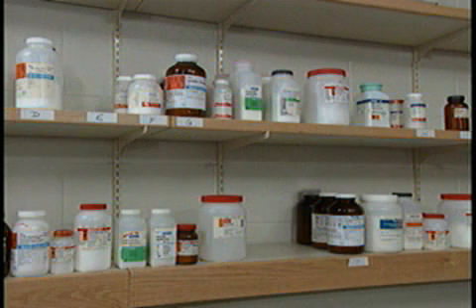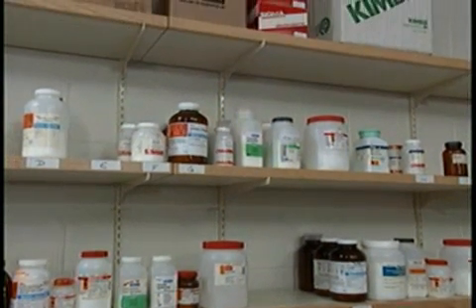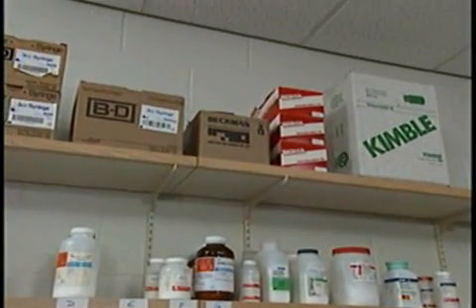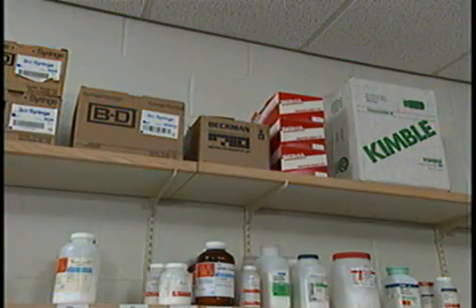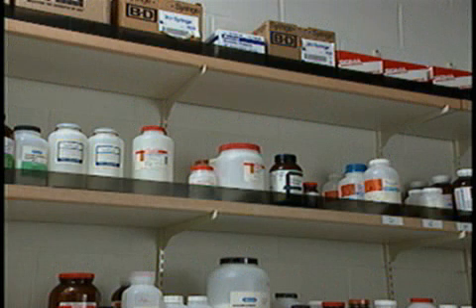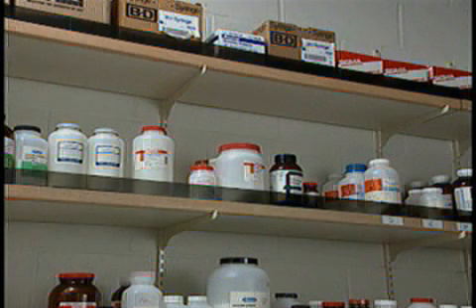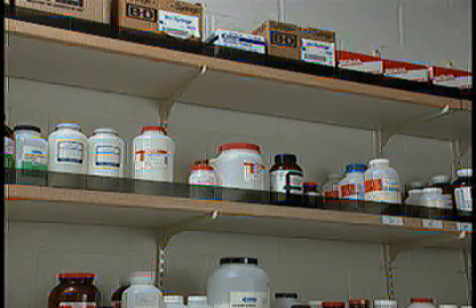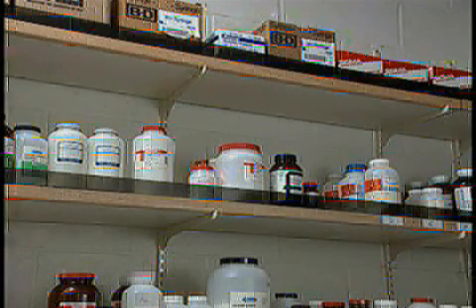As they put the first group of items in place, they were careful to use the top shelf for things less frequently needed and that aren't too heavy. By the way, raised lips on shelves can prevent containers from sliding off in case of earthquake, fire, or accident, and they are highly recommended.